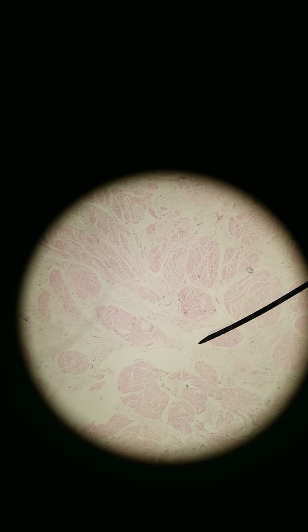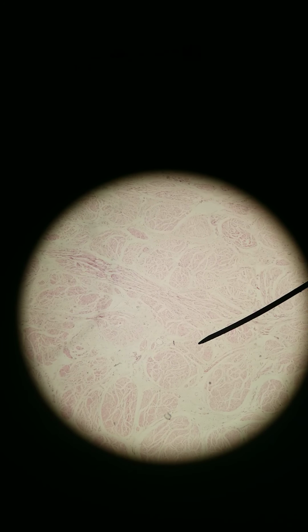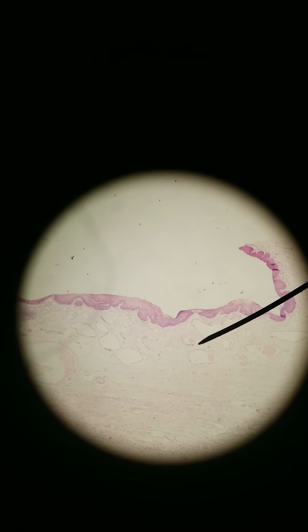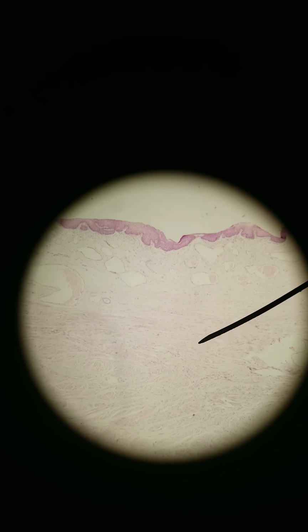Please say urinary bladder, not just bladder, because bladder could mean gallbladder. Bladder could mean like a bladder inside of a basketball, like an air bladder. Bladder just means container, something that stores something. So this is storing urine. Also transitional epithelium, much, much bigger because, you know, you need to store urine. And there's lots of muscle. Look at all that muscle. Smooth muscle. All of that.